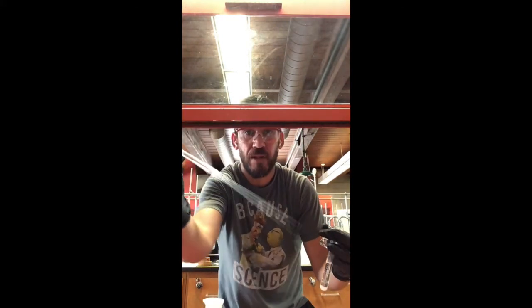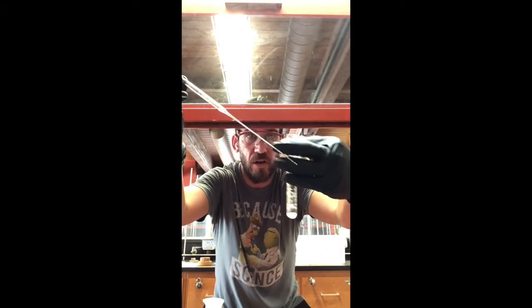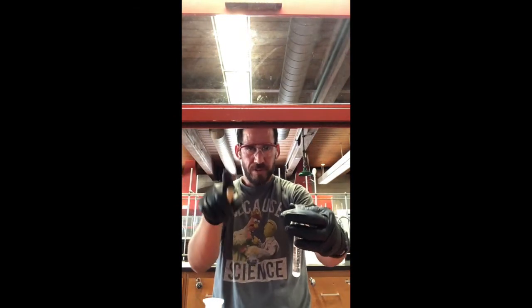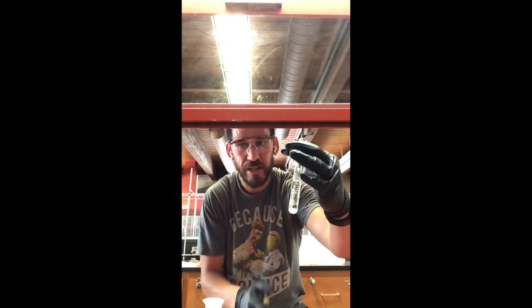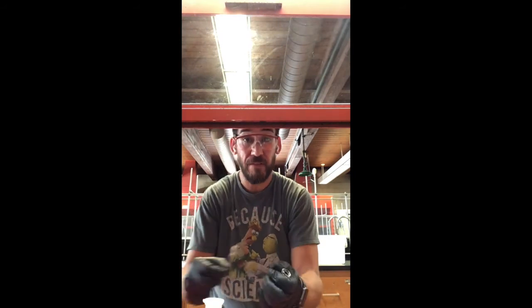Next thing, pipette. This is that yucky pipette, eh? Do you guys know what that is? Did you figure it out? It's caffeine, right? So as methylene chloride drips, we squeeze that out into here, and then some of it's left behind though, right?